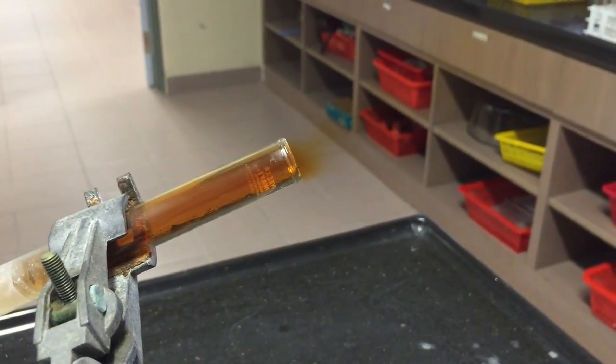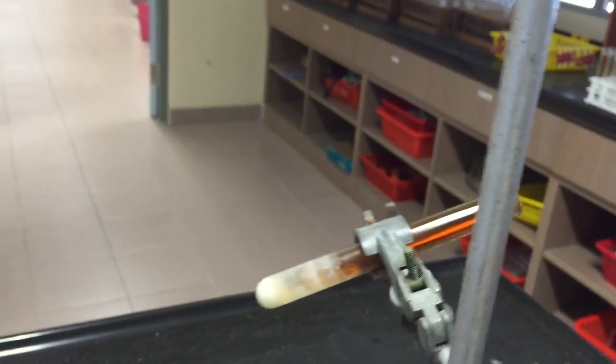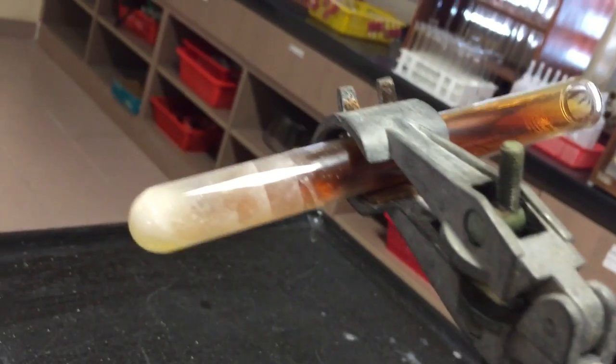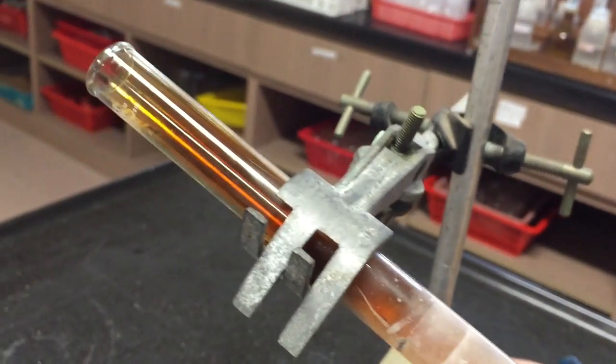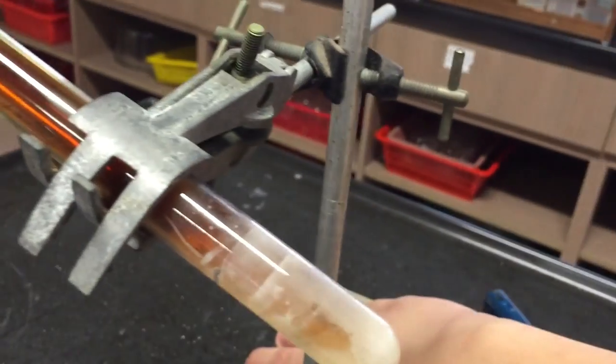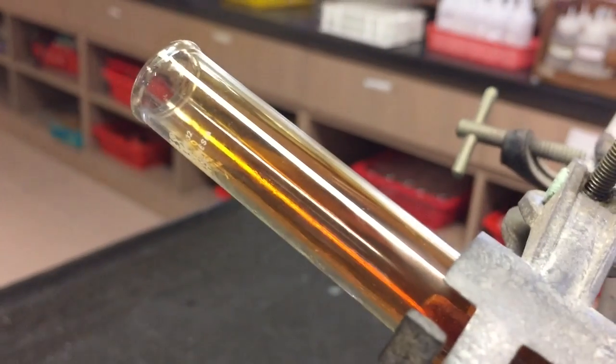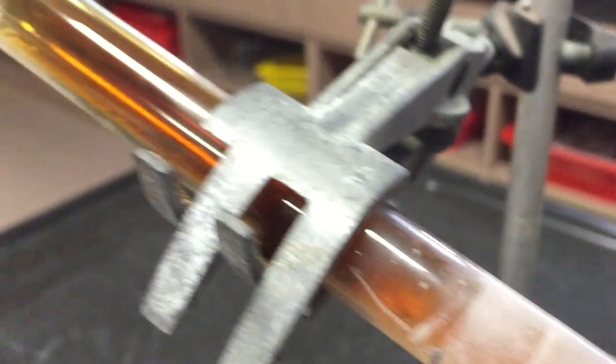Perform the oxygen gas test first before proceeding to the NO2 test. While the brown color of the gas is still there, the NO2 is still present. So you need not worry about the gas escaping too fast for you to perform a litmus test. Notice how the NO2 gas is very dense and stays within the test tube for an extended period of time. You may take your time to prepare your moist litmus paper samples to test for the presence of an acidic NO2 gas.